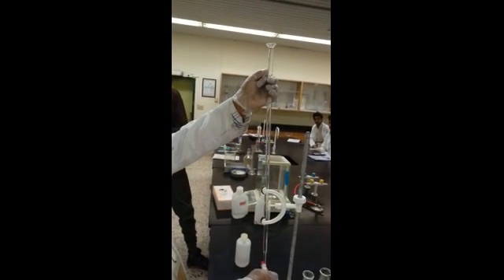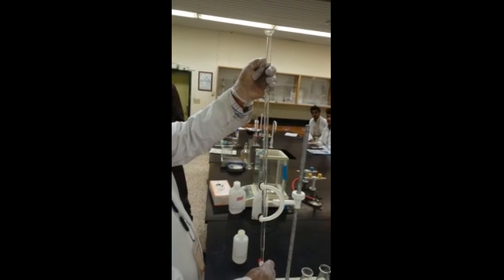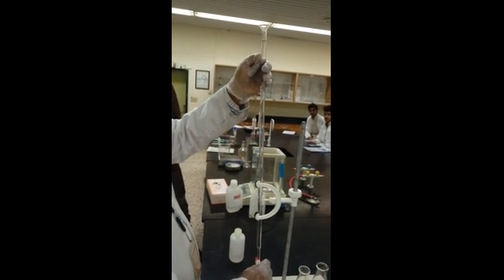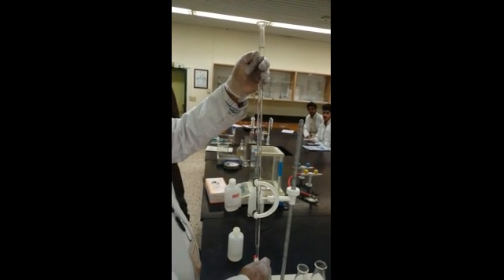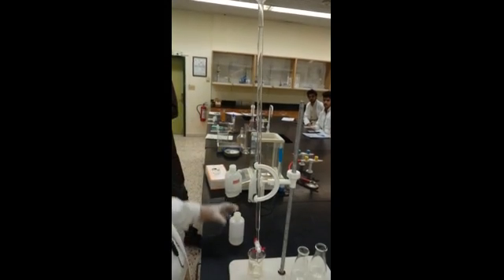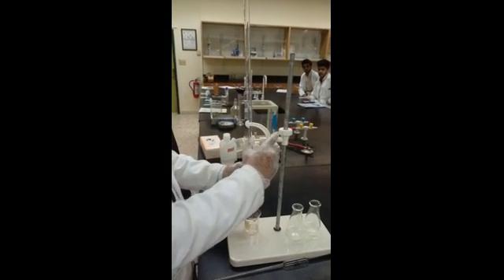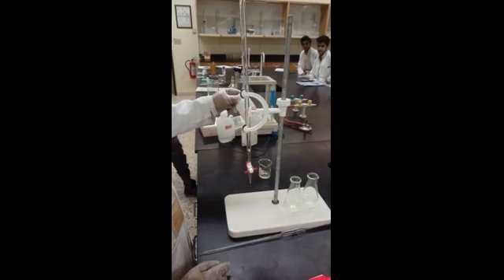And just bring it down and see where is the 0. Can you see the 0 is here? So that you bring it down to that place. Once it is done, you fill the NaOH chemical.